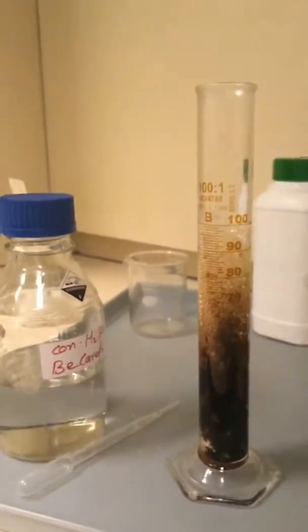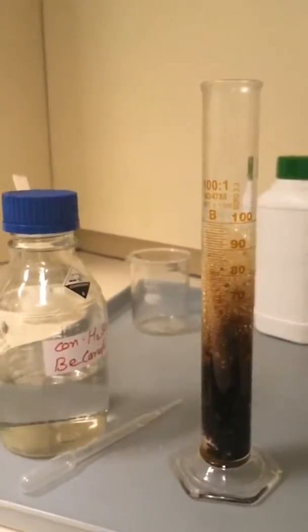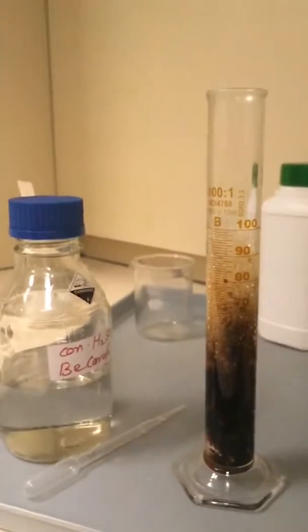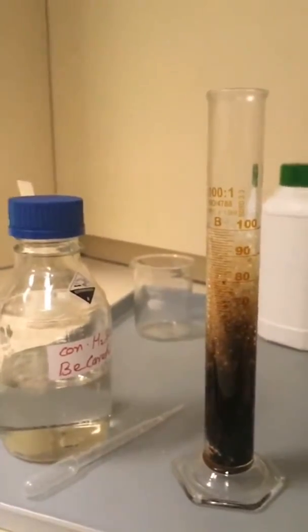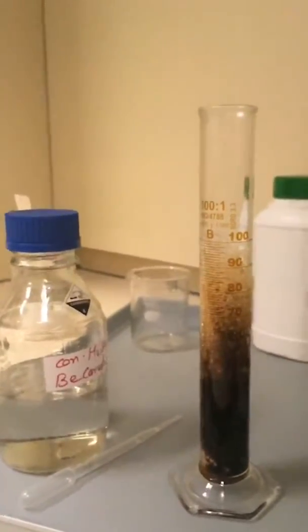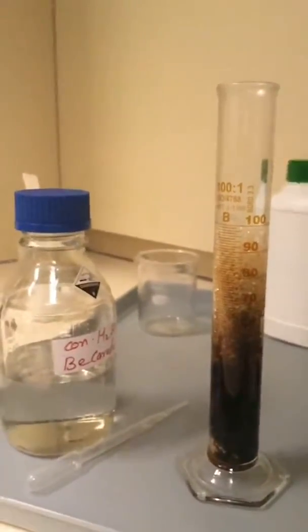Okay, thank you. I'll just put some tap water in it, will use tap water. Thank you. So it's going quite nicely. It's turned black. It's not quite out the top of the cylinder yet, but I will use full protective equipment while squirting water at it, which will help it go a little bit more quickly.